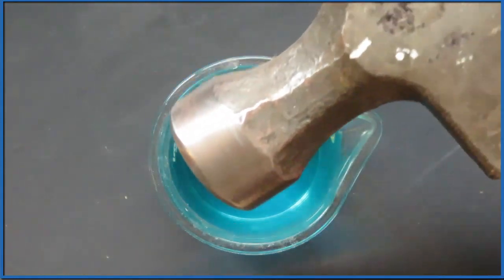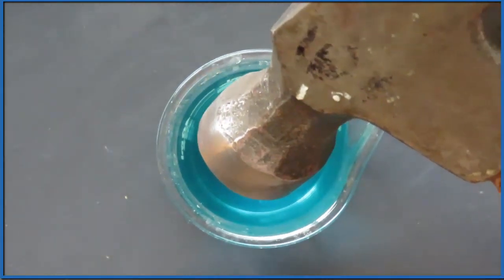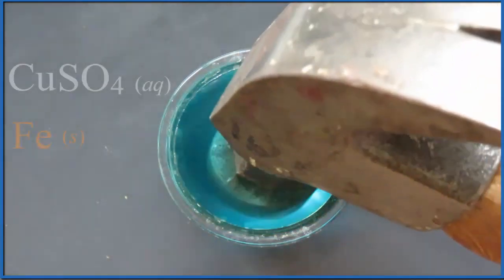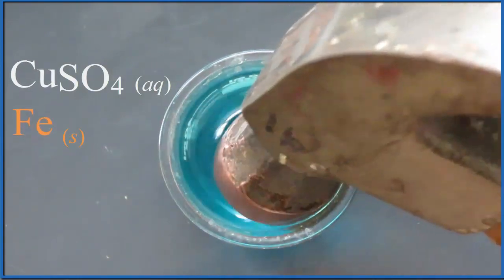So we put the hammer into that solution of copper 2 sulfate and we can see the single displacement reaction take place right away. It's really quick.